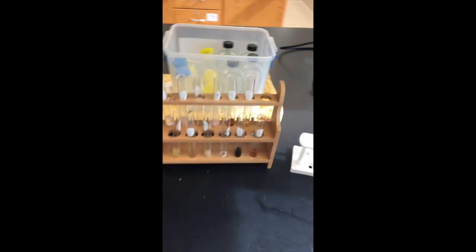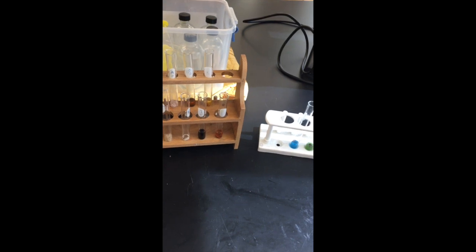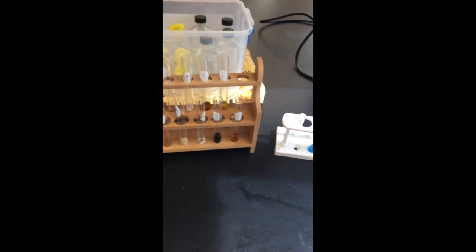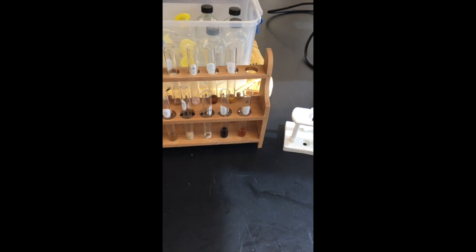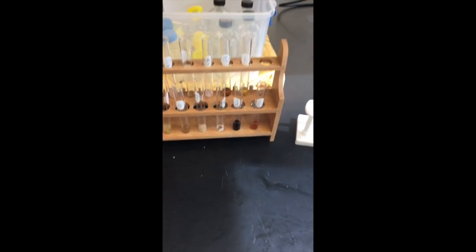In summary of our little experiment, what we are doing is we are trying to detect different macromolecules in our food: to detect complex carbohydrates or polysaccharides, to detect simple carbohydrates, monosaccharides, to detect protein. And basically, in looking at that, we had 3 different tests.